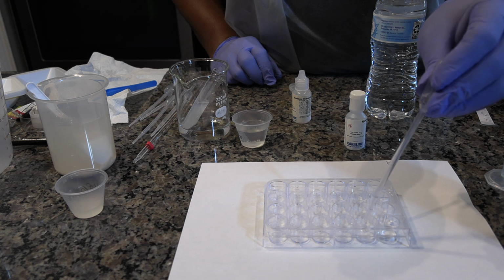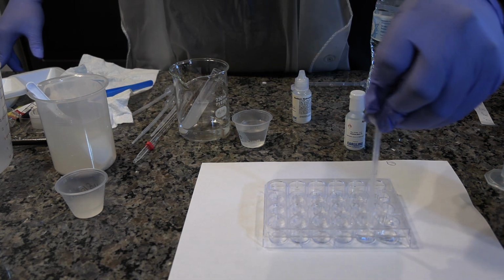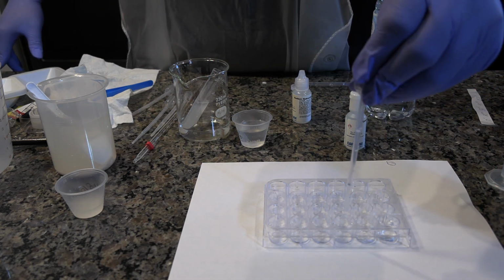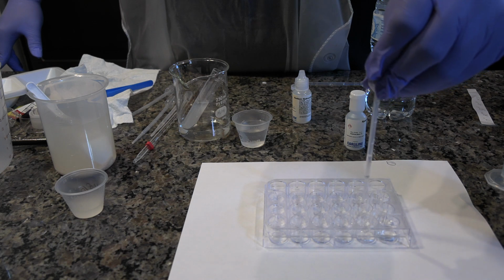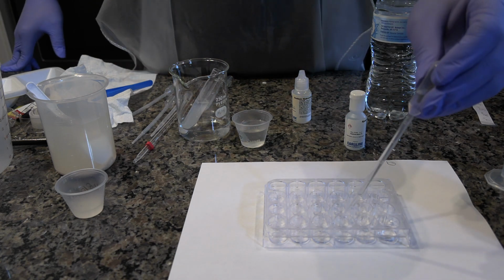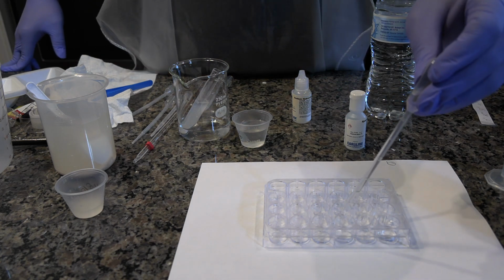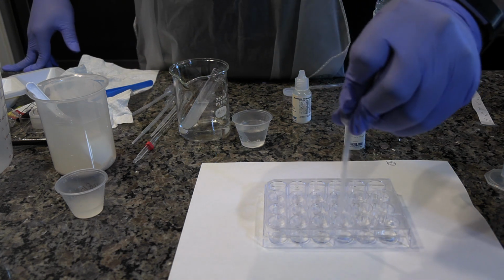Rinse each pipette by drawing water into the pipette and expelling it into the sink or into a waste bucket. Using the pipette labeled acid, dispense 2 drops of the solution from well A2 into well A3 and 10 drops into well B2. Using the water pipette, dispense 18 drops of water into well A3.